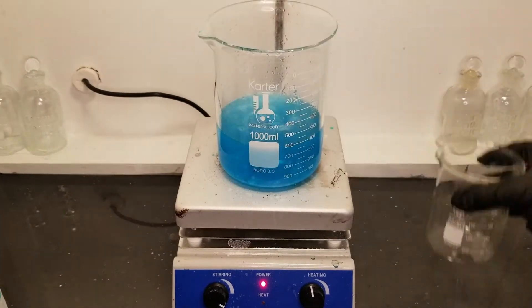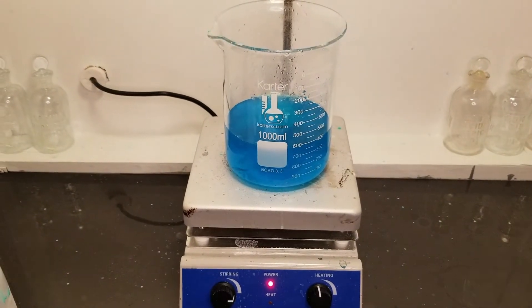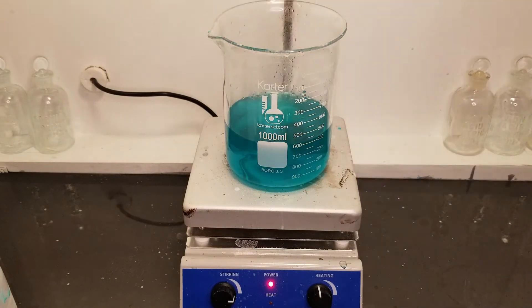Now, concentrated hydrochloric acid is added in small amounts until the solution turns a clear green.